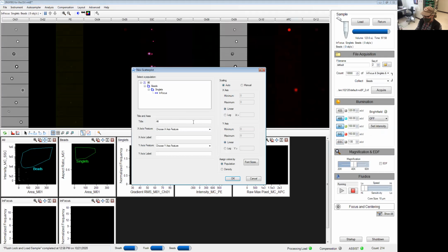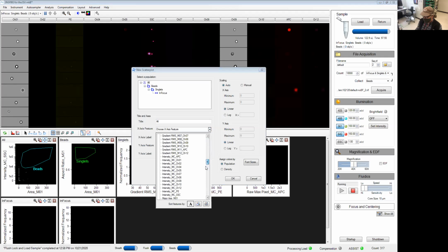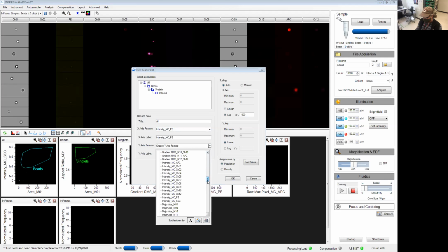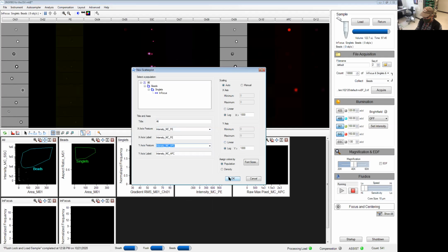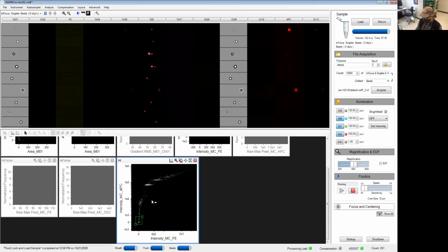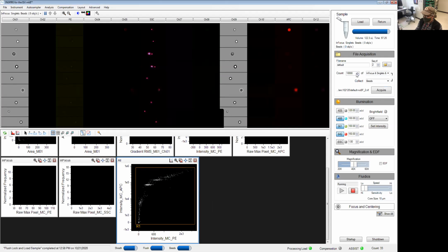So what I'm going to do is make a new graph. I'm going to look at the intensity of PE and APC. But this time around, I'm not going to gate it on anything. We're going to keep it on all of the events. And we have here APC signal and all the beads. I'm just going to gate these guys here. R1 is fine. Change my count to 10,000 in the R1 region.